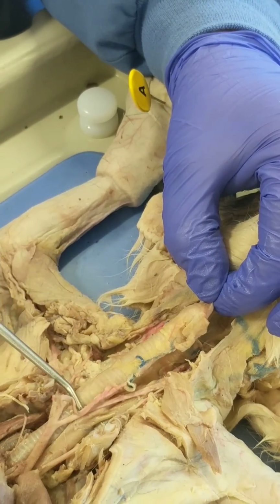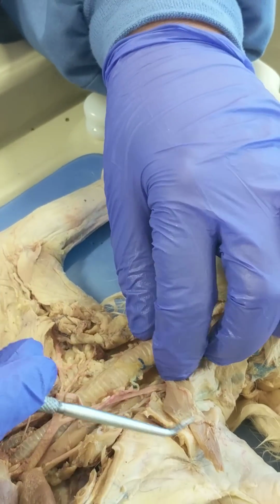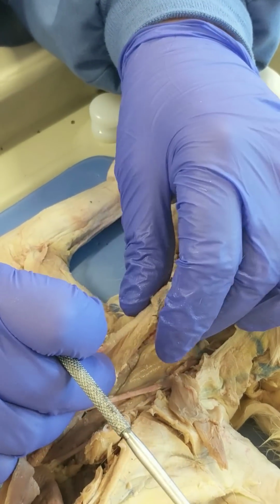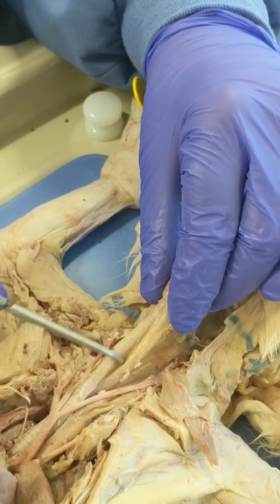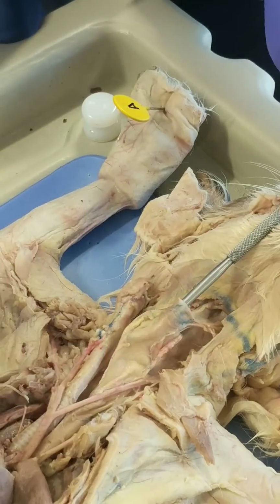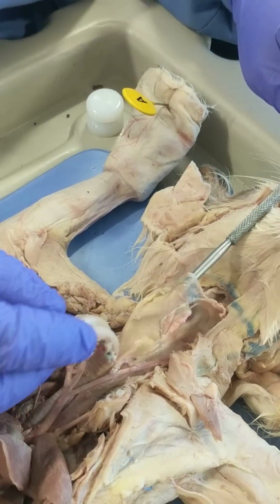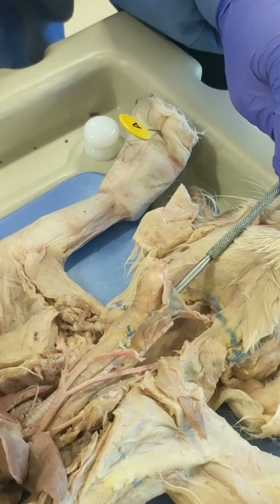This is the trachea, and you can see the cartilage rings of the trachea. If you turn it over to look at the dorsal surface of the trachea, notice that the rings are C-shaped. It's soft right here. And that's so this esophagus can expand into the trachea if need be, but not very far.